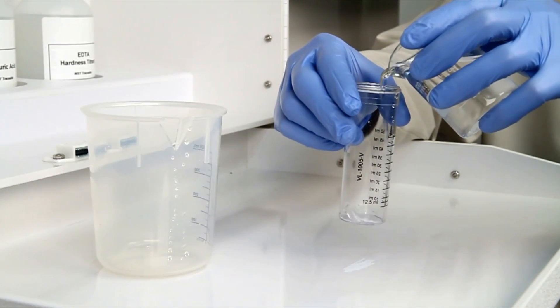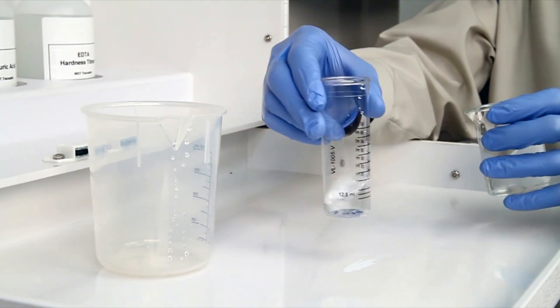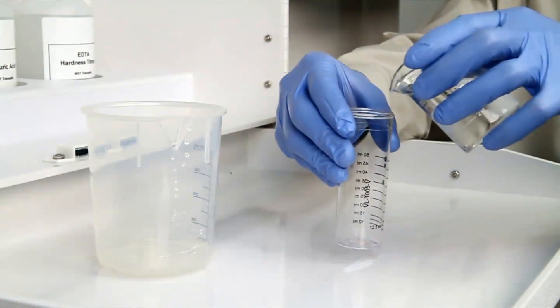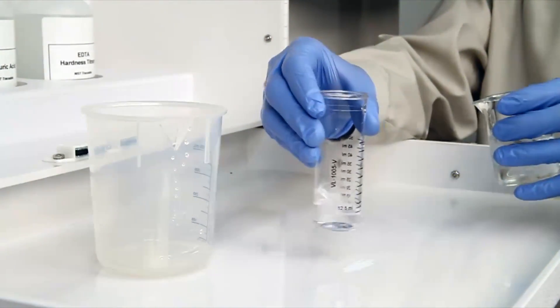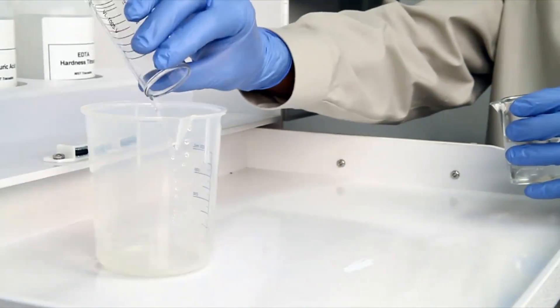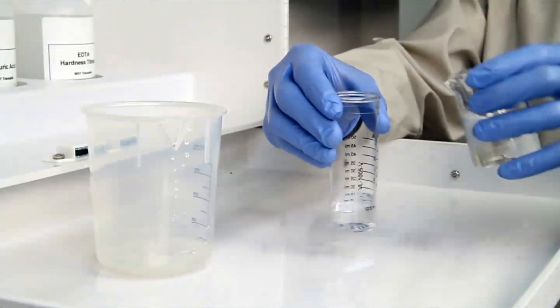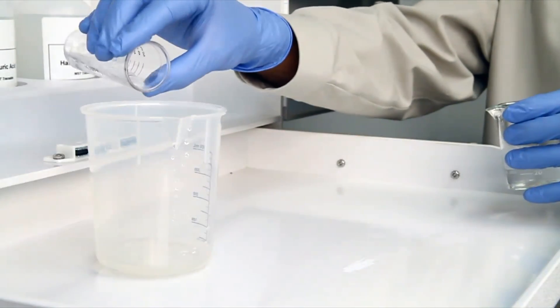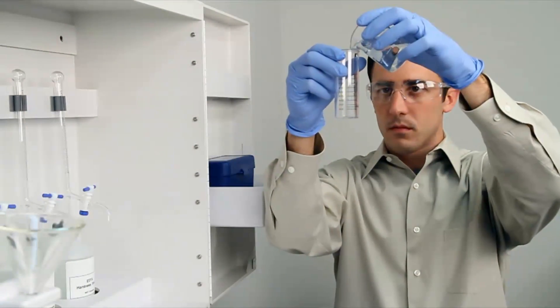The next step according to the Endpoint ID procedure is to take an accurate sample. The smallest change in sample size will lead to inaccurate results. Before gathering your sample, it is important to rinse the vial three times with the sample to be tested. This minimizes the chance of contamination from a previous titration.